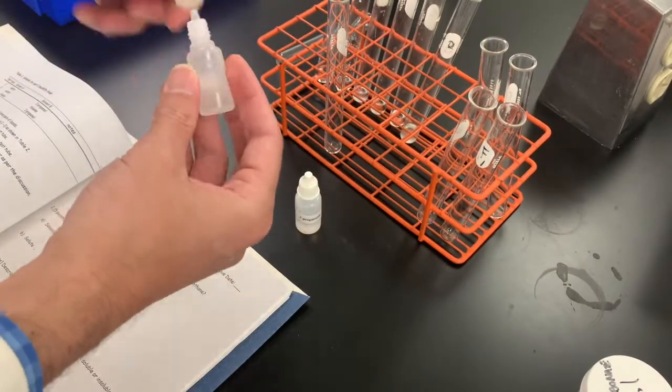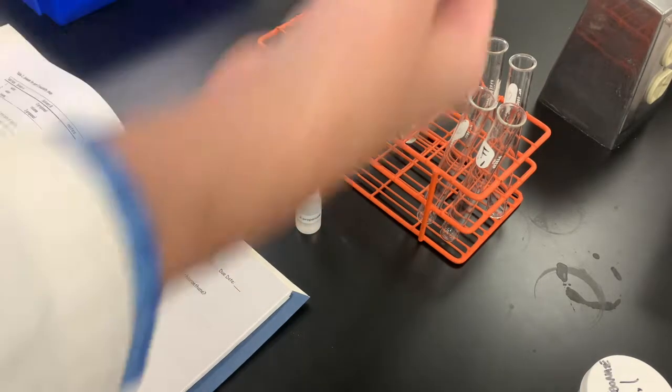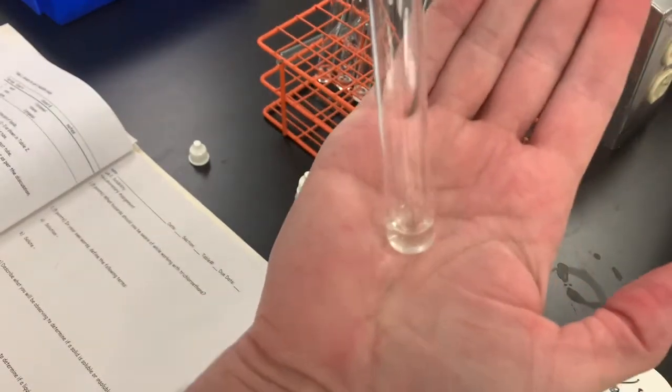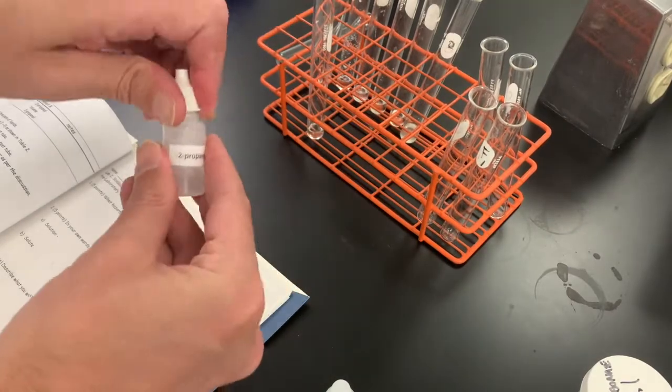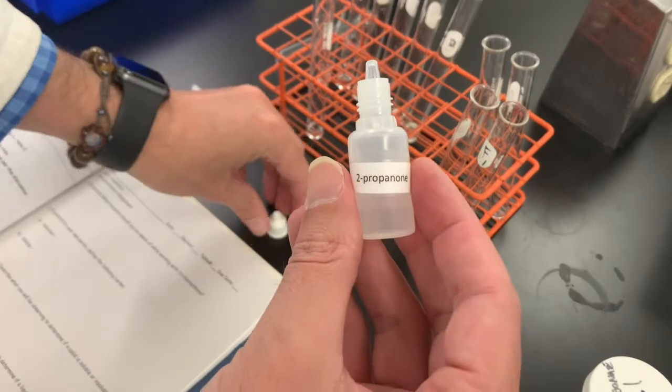For this, I'm going to squirt in about a milliliter of water. That's water right now, and then I'm going to squirt in an equal amount of 2-propanone.